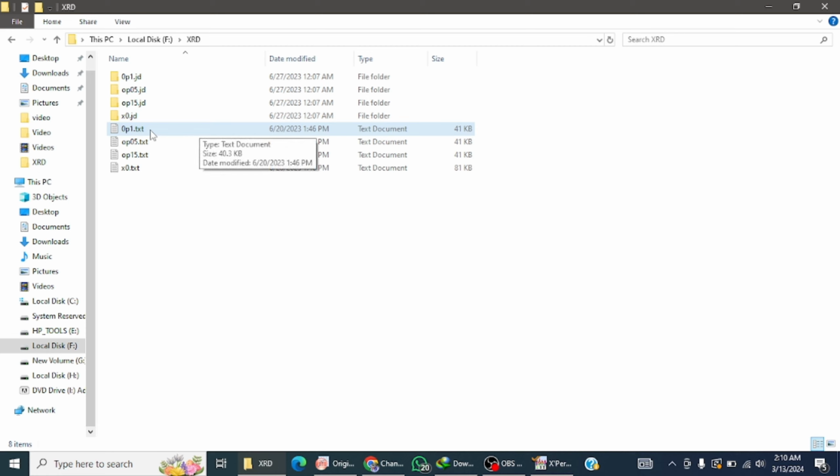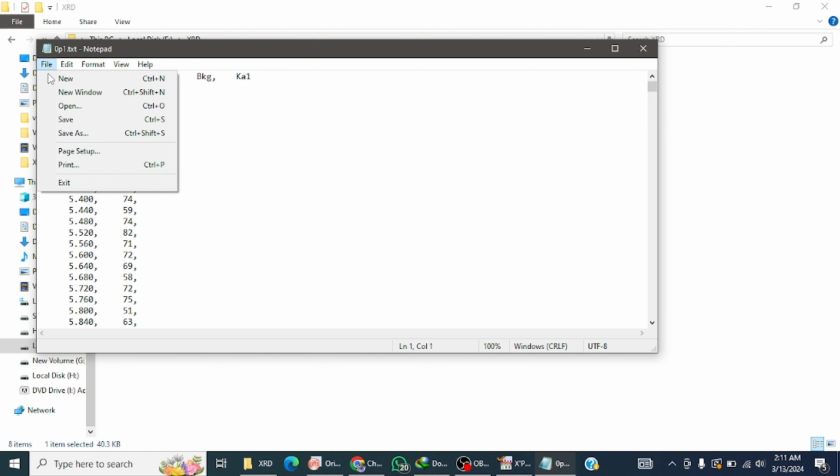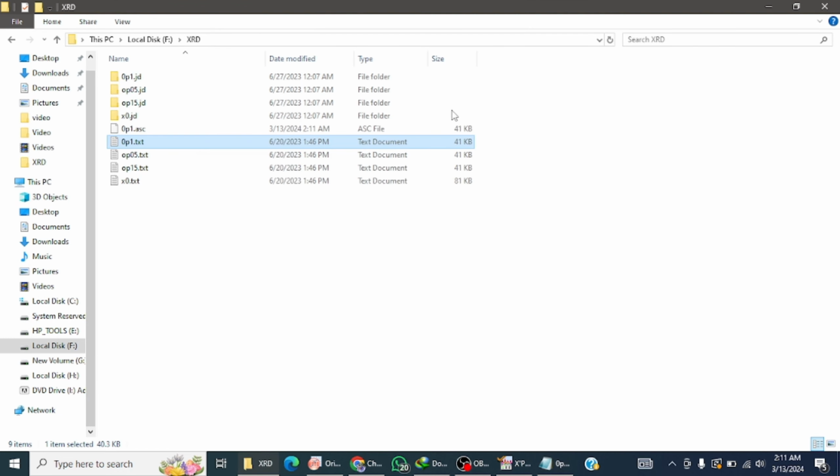So now I am going to change it. First you have to open this file, then go to File and click on Save as. You see here the name is op1.txt. You will remove the txt and write asc, and then click on Save.